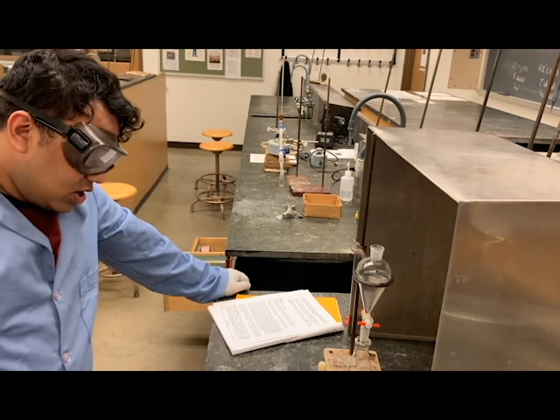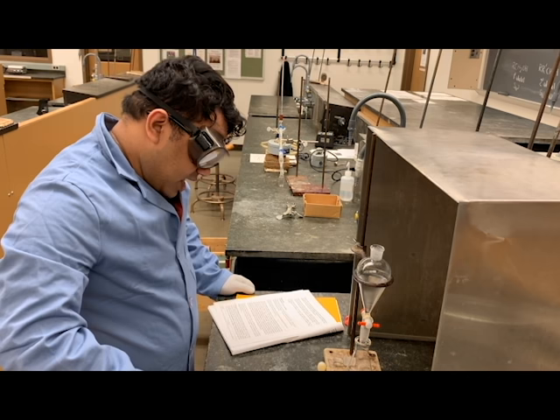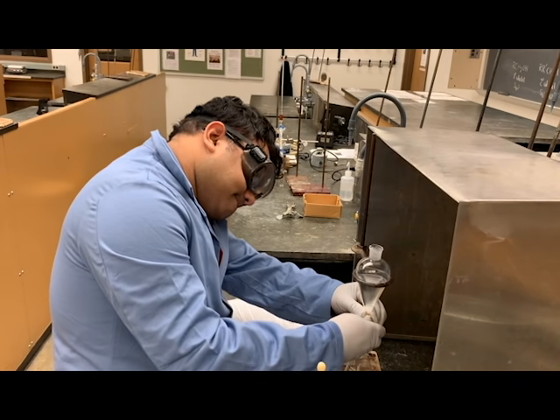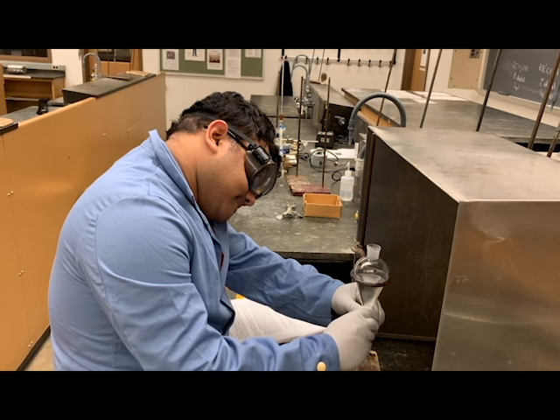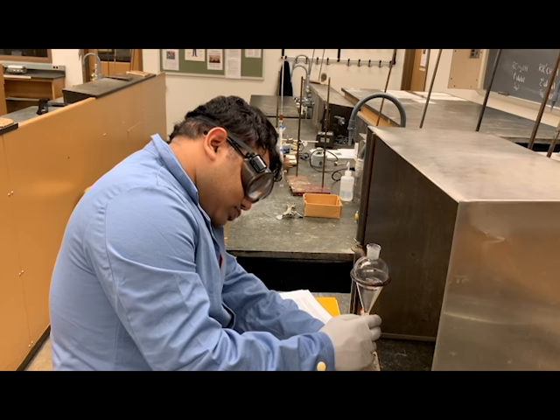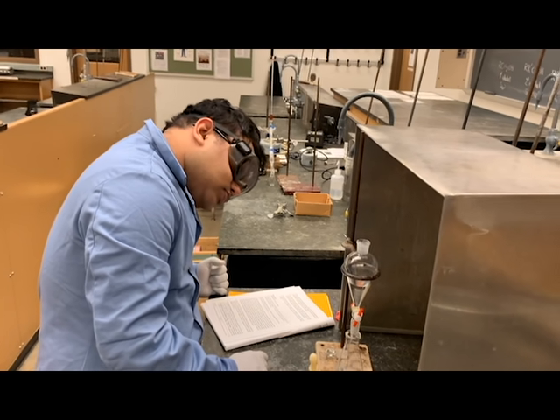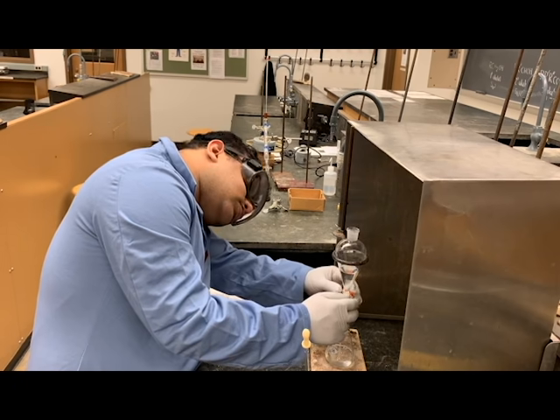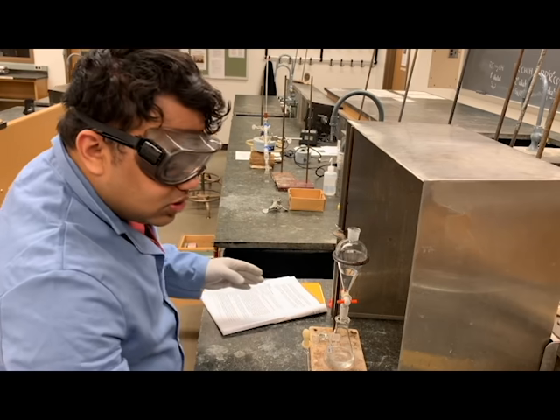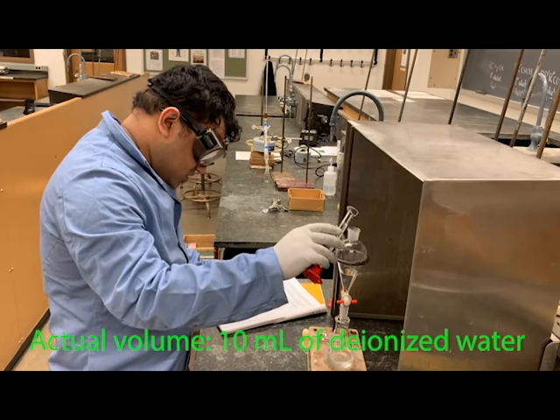Now that we know which layer is our aqueous layer, we are going to collect the aqueous layer in an Erlenmeyer. We're going to wash the organic layer with about 10 to 15 ml of DI water.